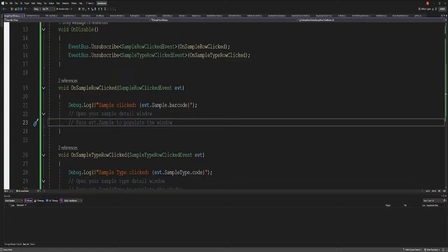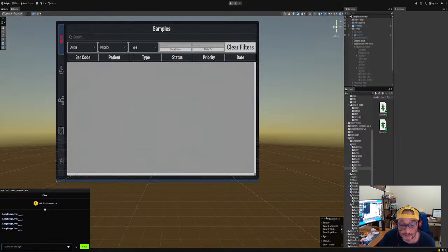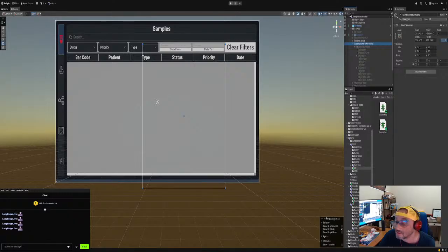All right, so let's go here. I haven't checked the chat for a while. Okay, everybody's cool with the chat. So for now, let's do this. We set that listener up, so we have to actually attach that listener to him. What was the name? Sample parent window. Okay, we got it done. So what we didn't do is this.